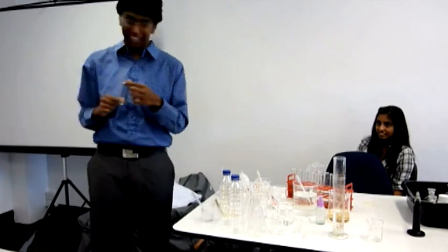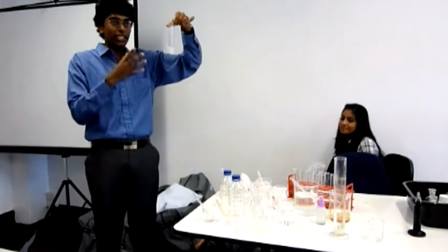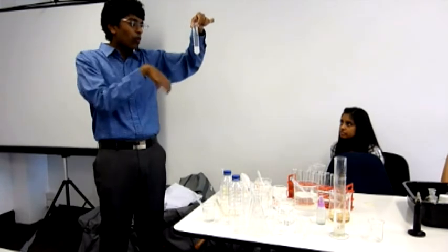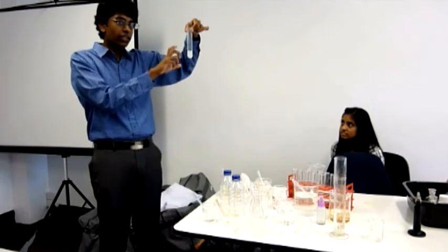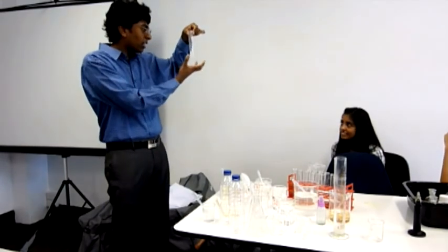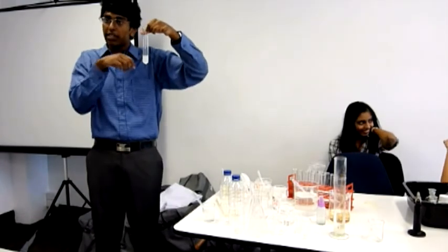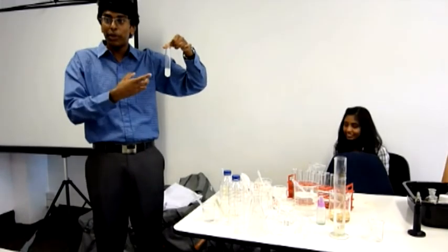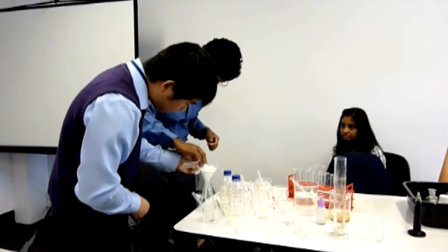You want me to make it again? New test. We have this problem, right, that we don't know which precipitate is forming at what time. So if we add another chemical, so we're testing for sulfate, when we add another chemical, if a precipitate is forming, this would probably go increasingly white. So the increase in the color, if the color becomes stronger, it would suggest that a new precipitate is forming as well. So that was what Hong was saying. If we keep this and use this to test again, then we will be able to know whether a new precipitate is forming on top of what we already had.